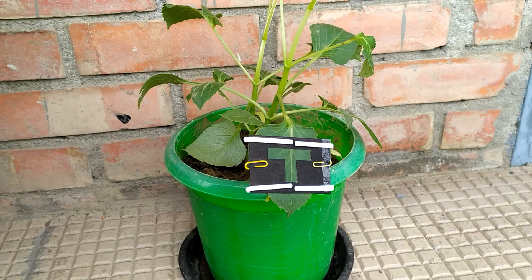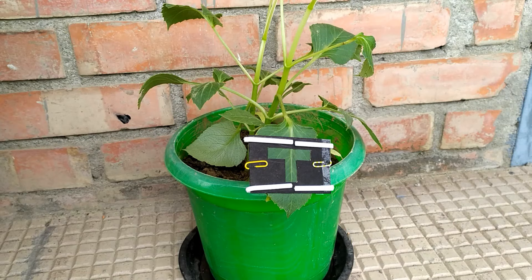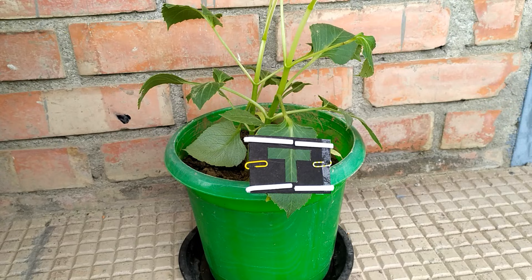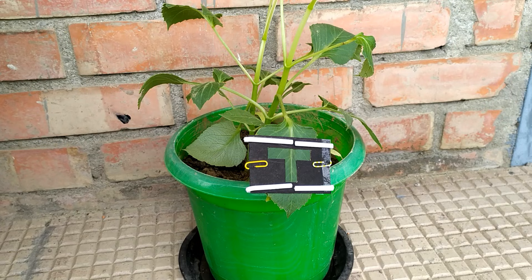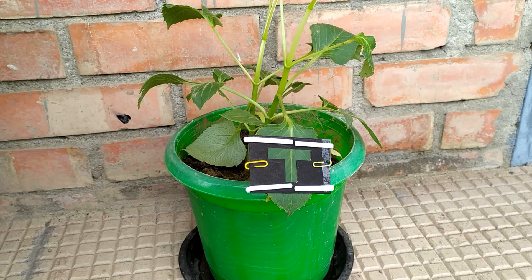In this experiment, we are going to investigate the role of light in the process of photosynthesis and find out if light is indeed necessary for photosynthesis to occur in a plant. For this experiment, we'll need the following.